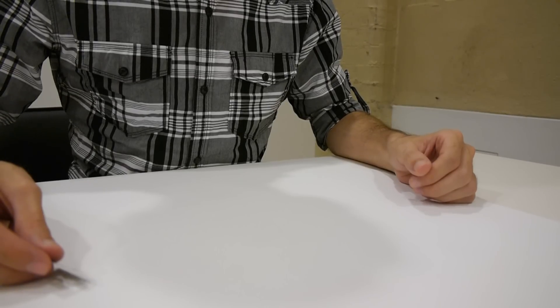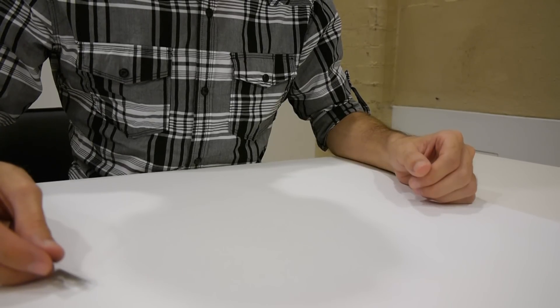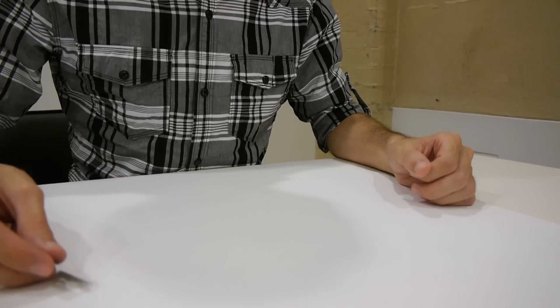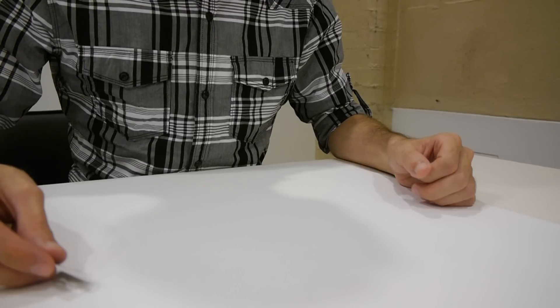In this video, I will demonstrate a modified freehand sectioning technique that can produce very fine sections from a wide range of material such as small, delicate and dry plant samples.